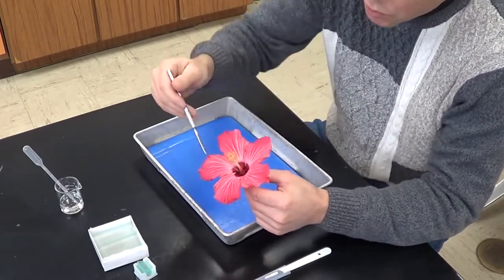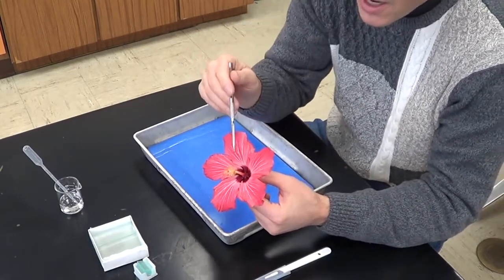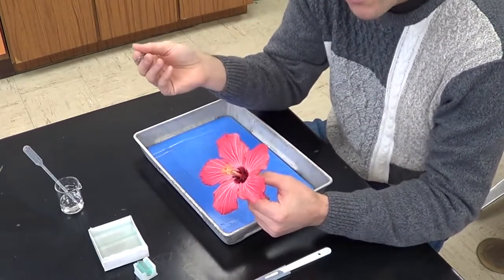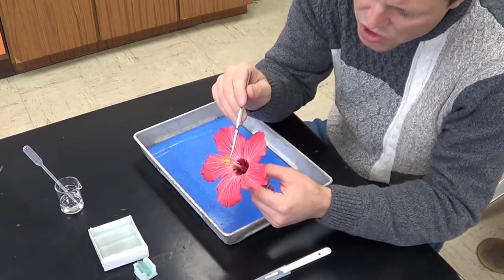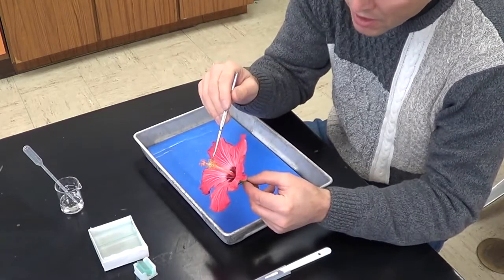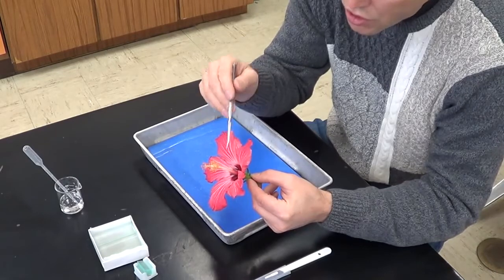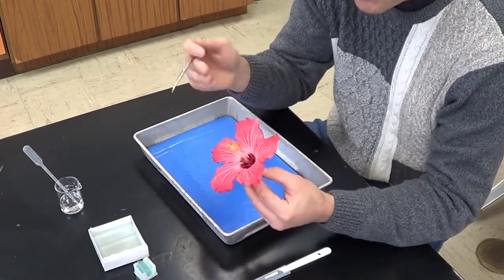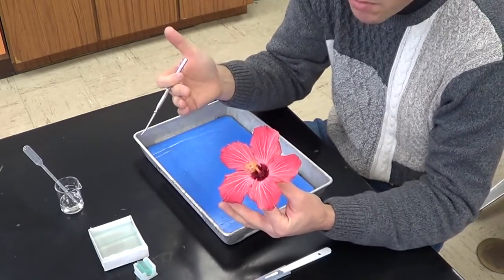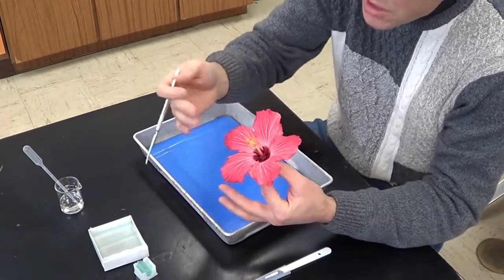Now let's look at the next whorl, which is this right here. And these again are modified leaves. This is the male part of a flower, referred to as the stamen. The yellow structures on the end are called anthers. And these anthers are held up in the air by this long wire-looking structure called a filament. That filament helps hold the anther up high. The anther actually makes the pollen, which contains 2 sperm.